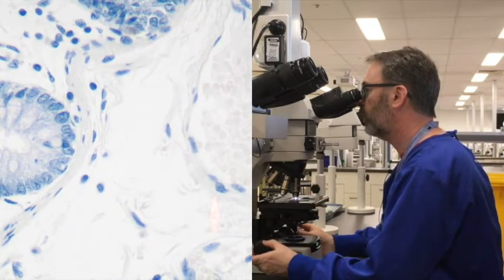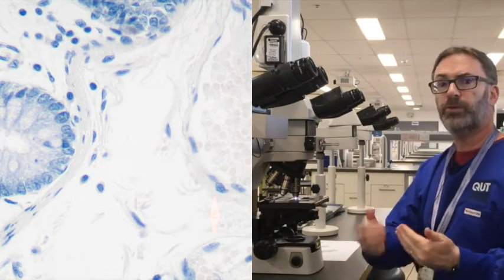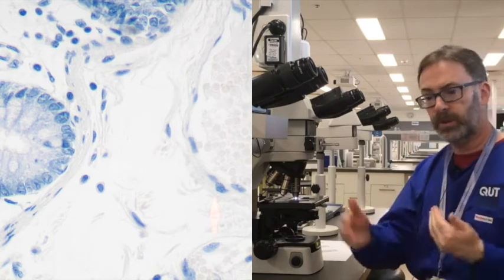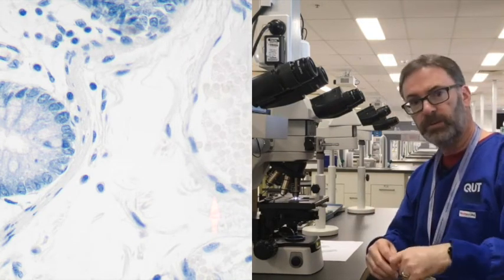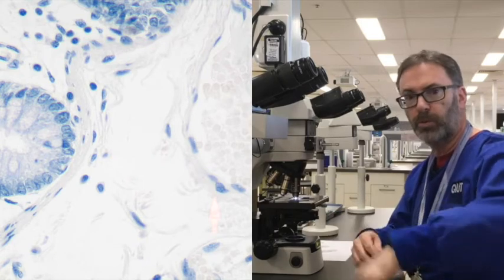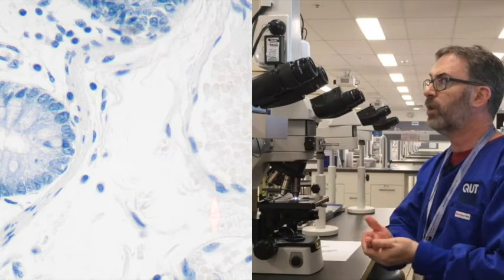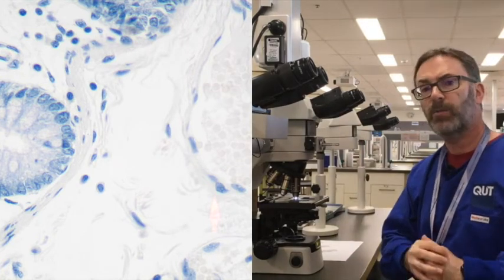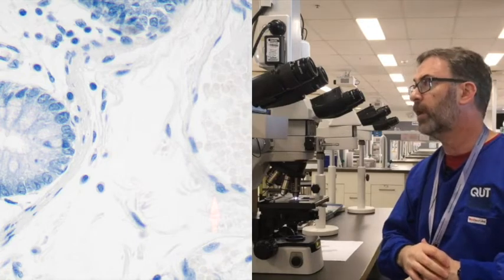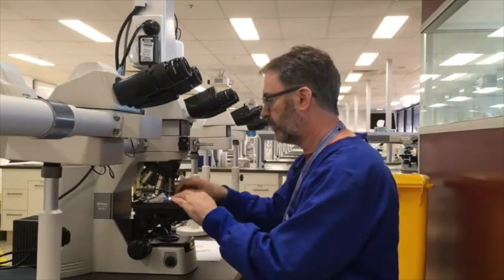So this is the point that you would ideally aim to get to when you're using the wet microscopes within the lab each week. You do 1, 2, 3 dips in acid alcohol, back to the water bath, blue the section with the ammonia, rinse that off, recheck it under the wet microscope, and this should be approximately the level of staining that you should have. Okay, so this is quite nice.